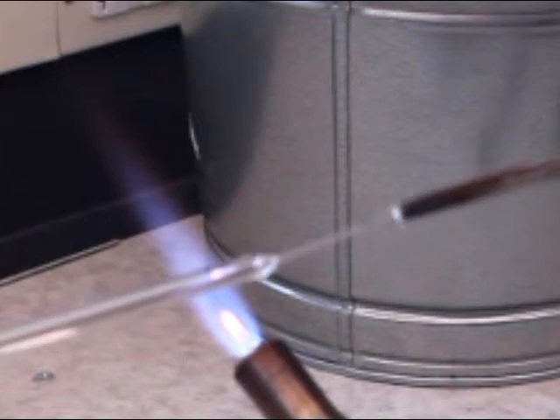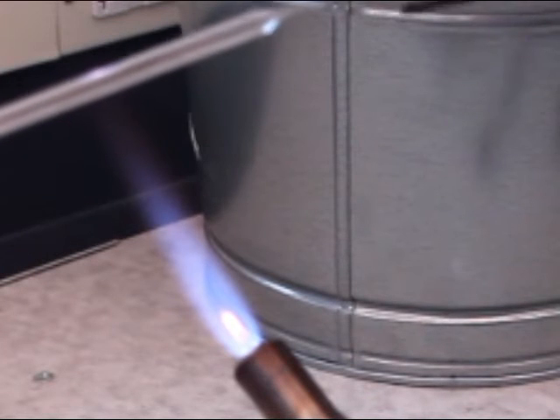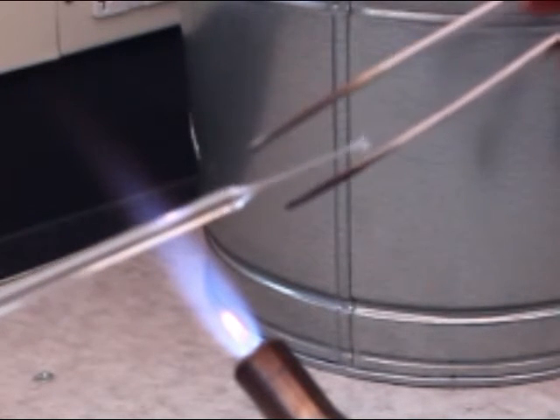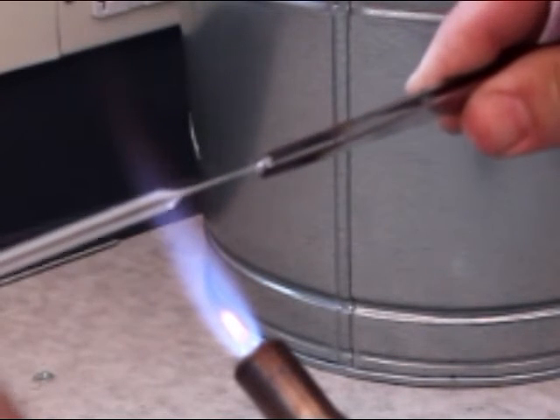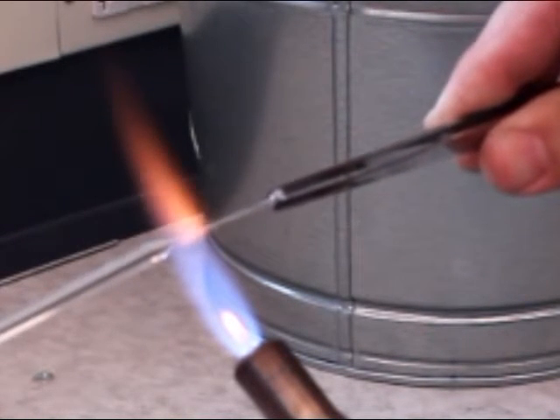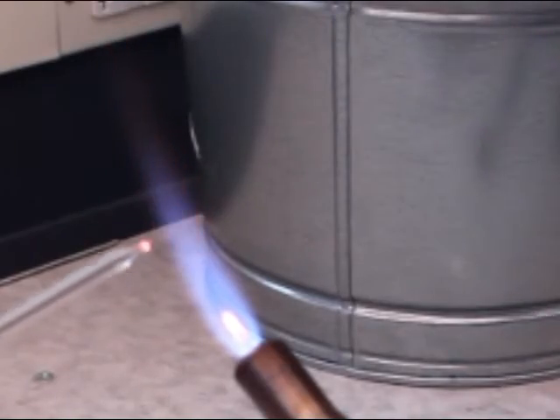Come in here, pinch it, give it a little pull — you can see I've pulled a little glass blob and got this glass filament. Come back in near the top of the flame and just burn that off, throw it in the trash.